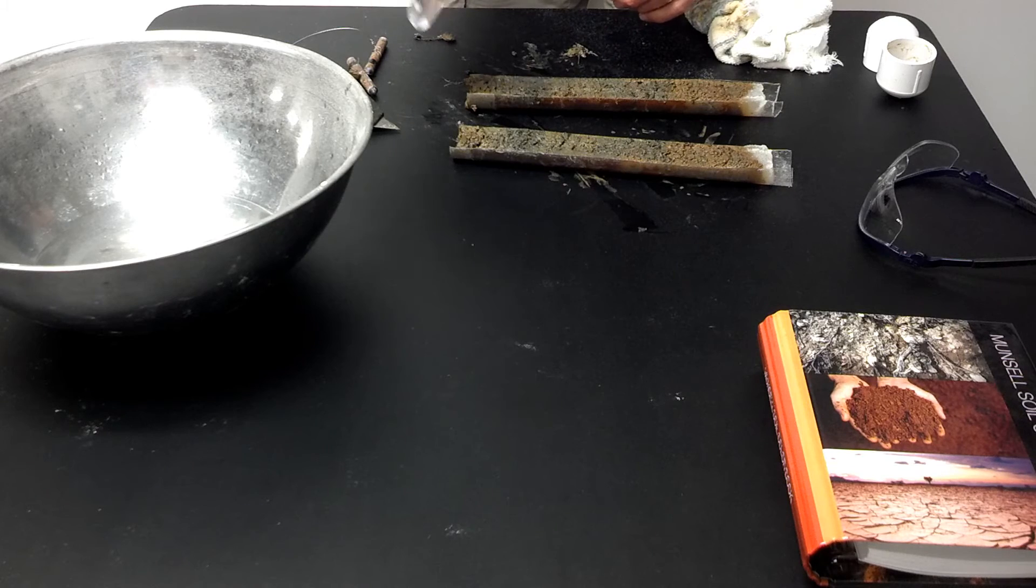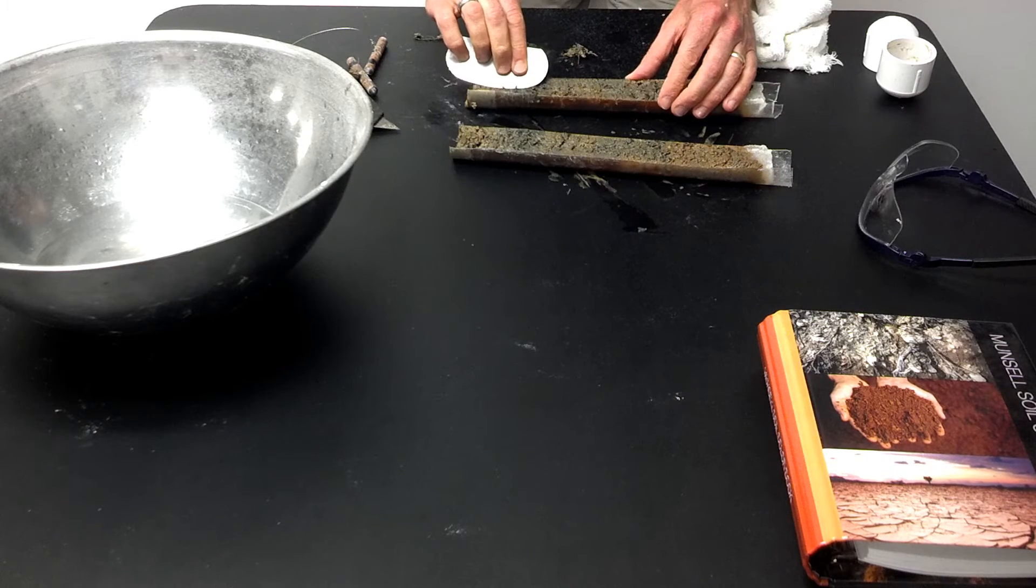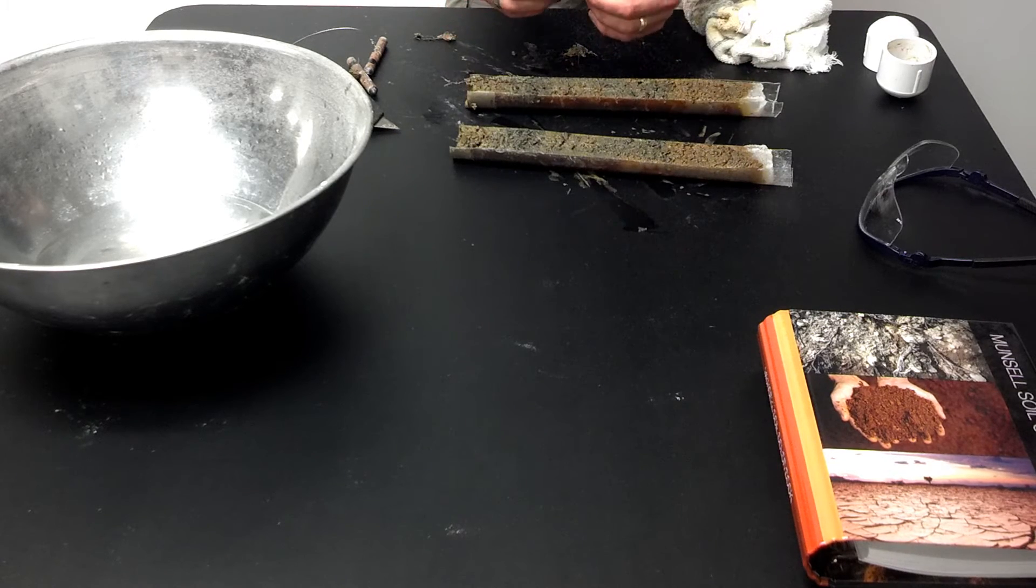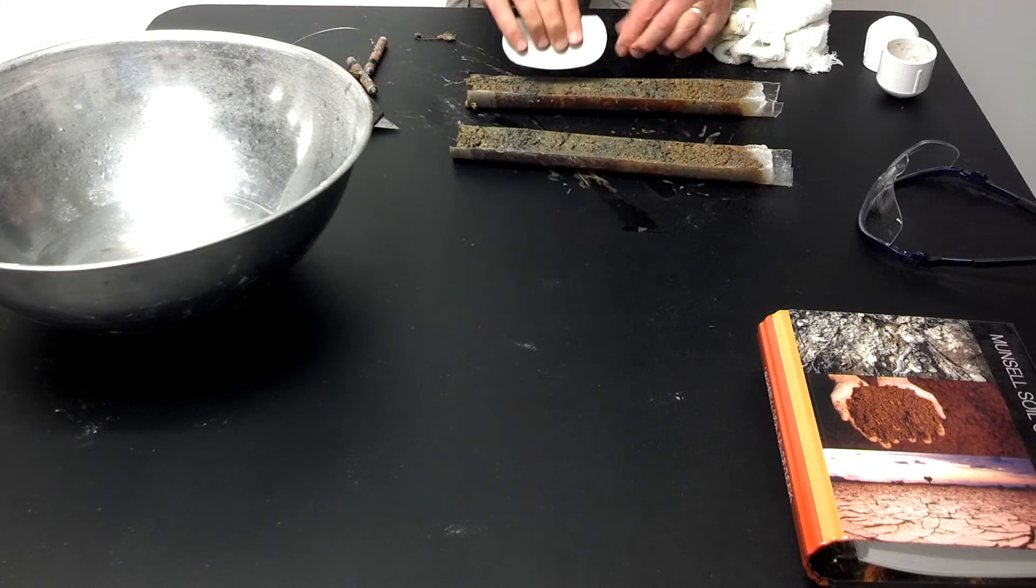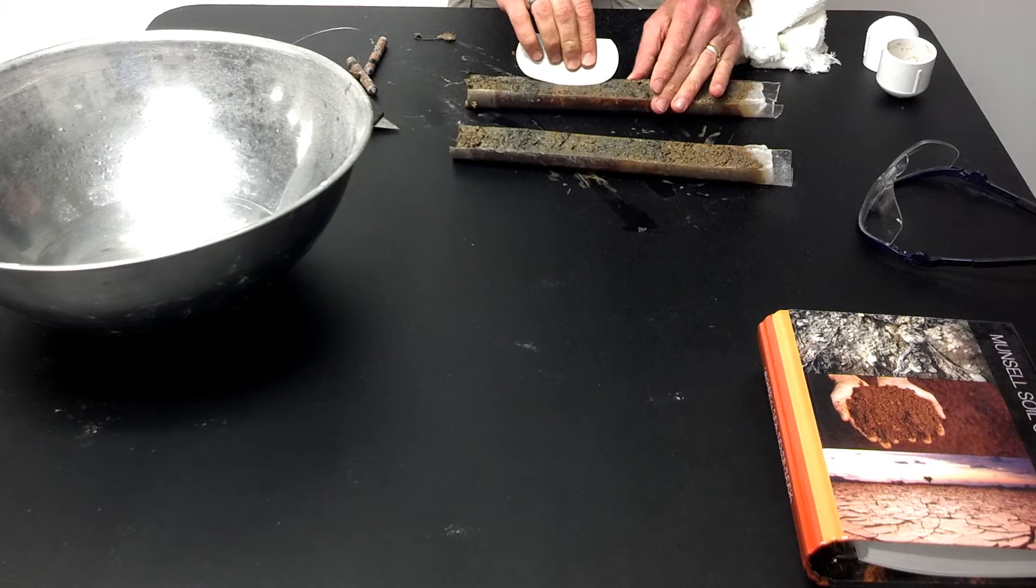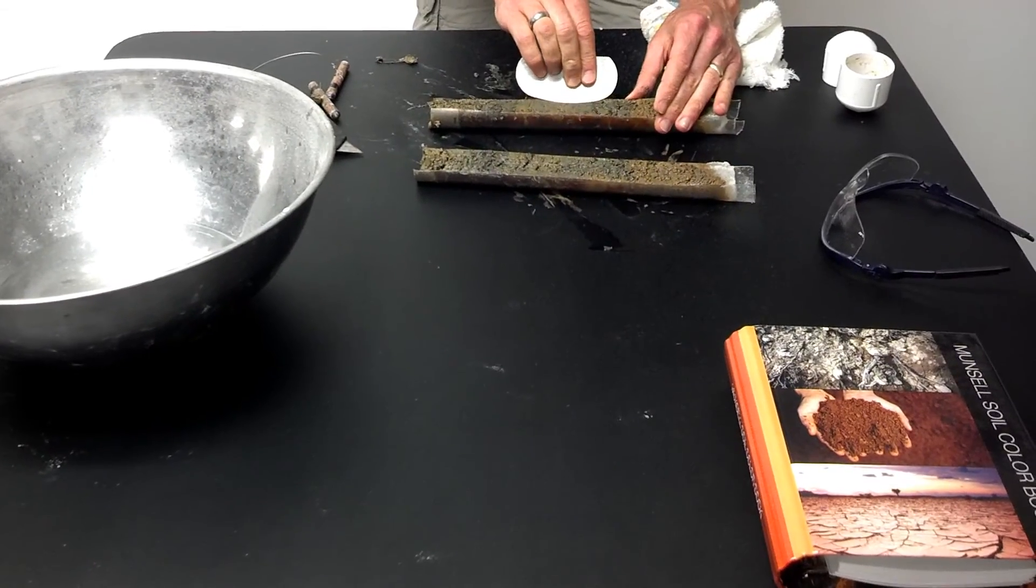Here's another tool that came from a ceramic supply or pottery supply location. I'm going to just gently scrape the top surface of the sediment off of my sample. By doing this, I will scrape away any debris that got pulled up from the bottom.